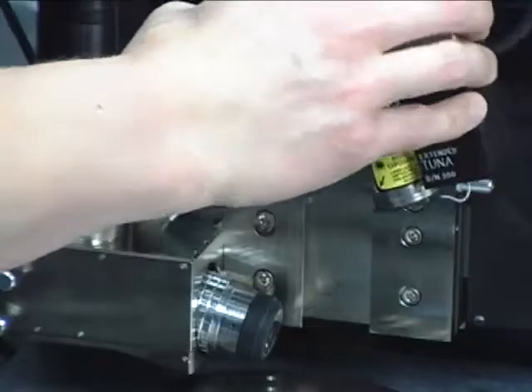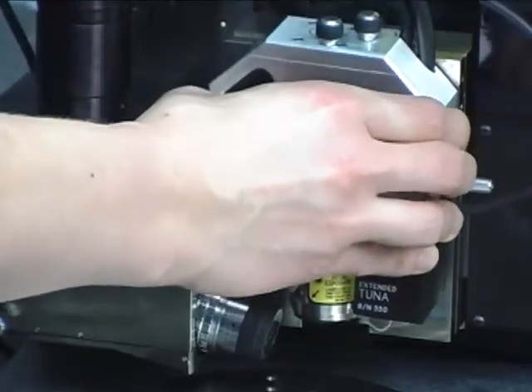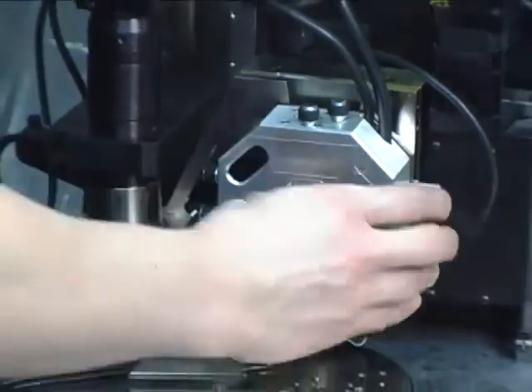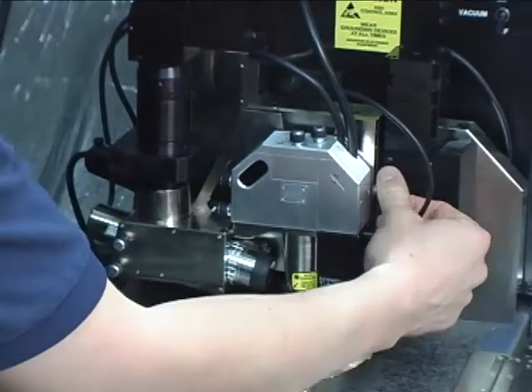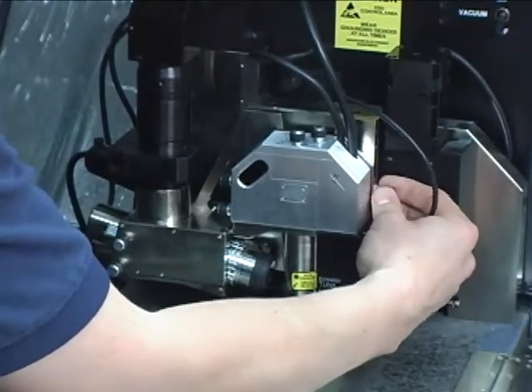The scan head can then be placed back in its dovetail and the thumb screw released to lock it into place.